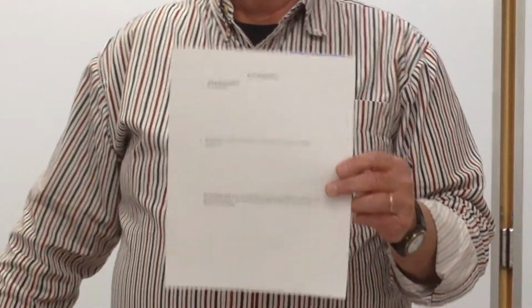Now, the way I've got this lab designed to engage students hopefully early on and get them to buy into this experiment, I have asked them to do two things before they even do the experiment. Here I've got a sheet of pre-lab questions, which I'm sure you probably cannot see. There's 3 questions though, and again, this is part of the experiment package, and this will be posted on the course website. So again, the intention is to get them thinking about density. What is density? How you calculate it? Again, the students would do this before they do the actual experiment, and this will be attached to the lab report that the student would do to send to me.